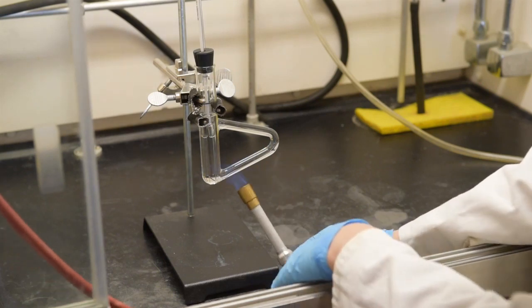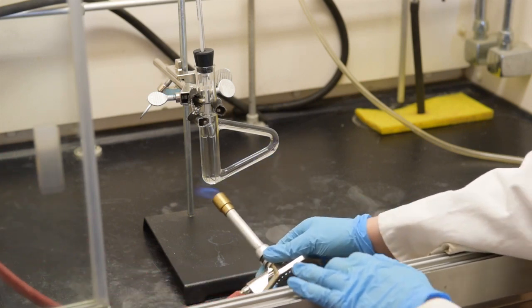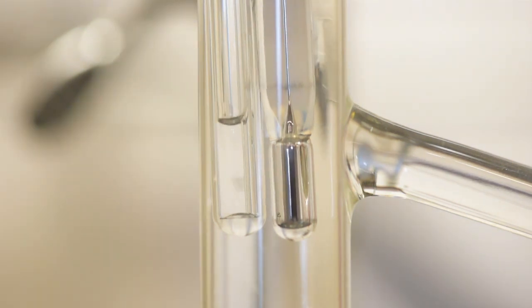Once that temperature is reached, begin to heat the system again by the same method as before, but at a slower rate. Hold the flame further away from the tube to accomplish a slow heating, this time paying especially close attention to the bell tube around the temperatures you previously recorded. When you first observe a steady stream of bubbles from the bell tube, record this value. It should be within 1 or 2 degrees of the second temperature you recorded.